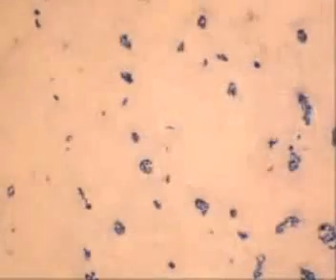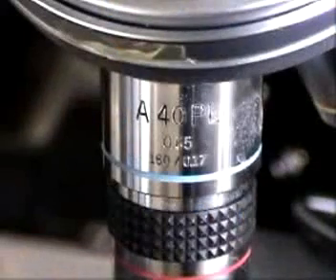Then back away using the fine adjustment and look what you'll see. You can see the yeast cells but not the bacteria, so now we'll go to 40x to see those better.